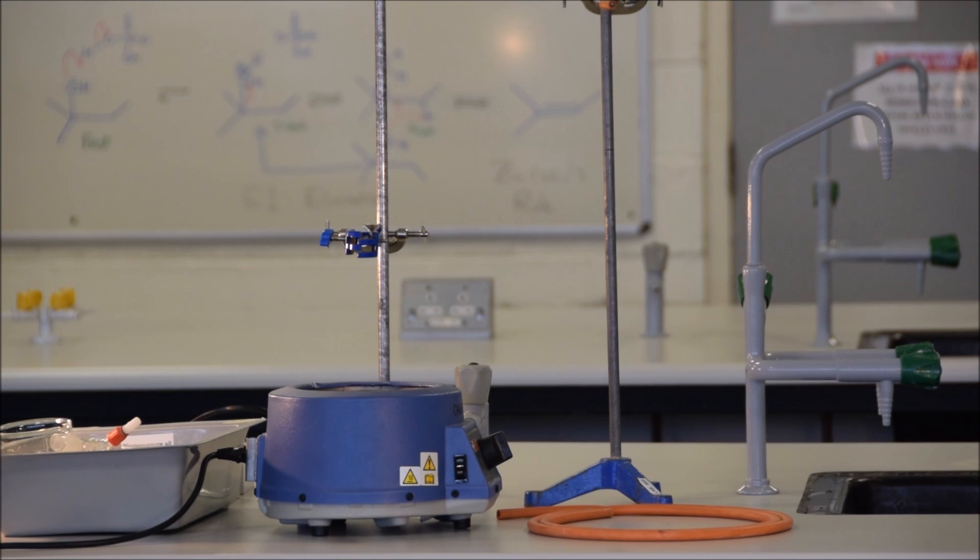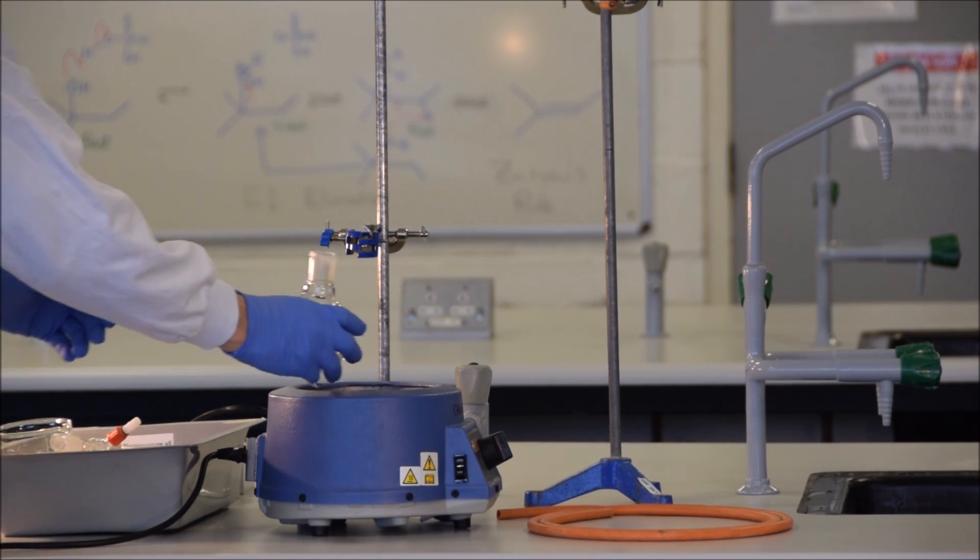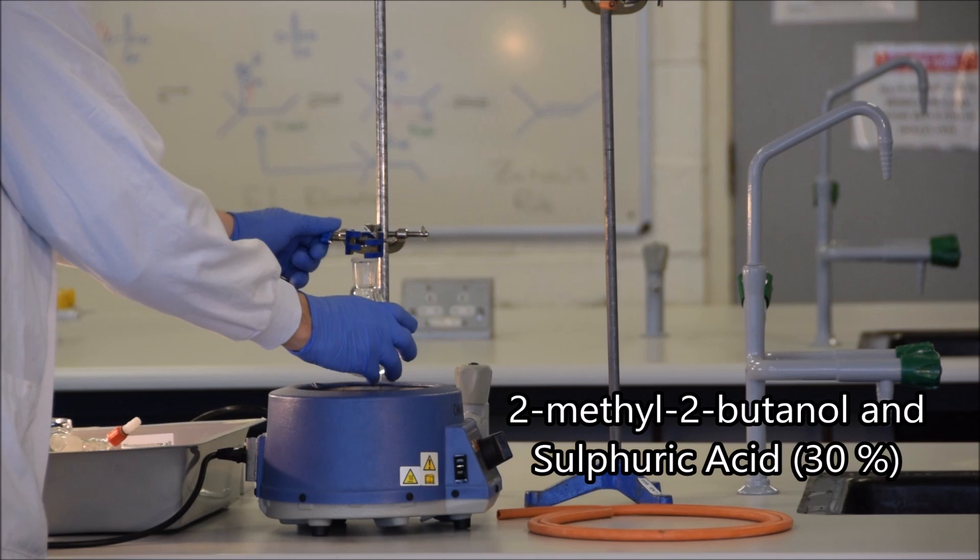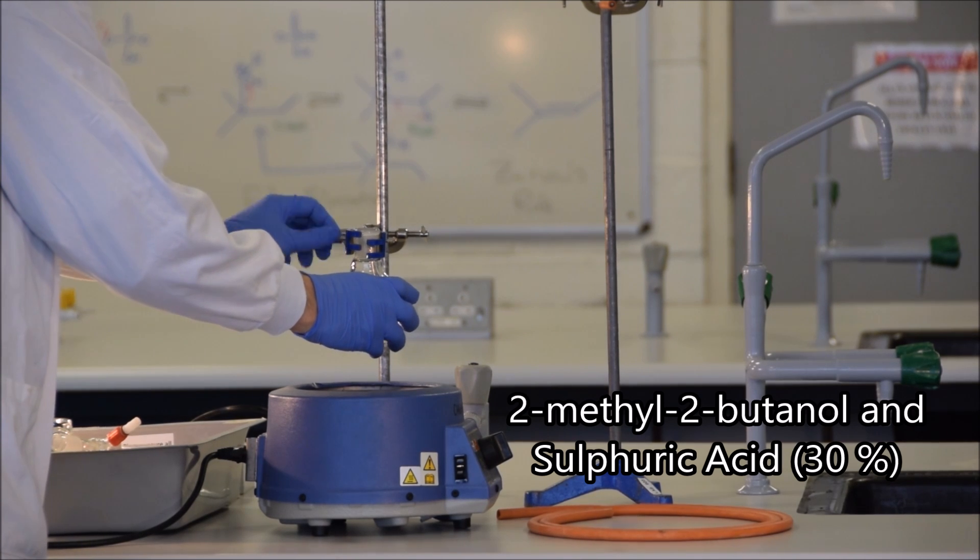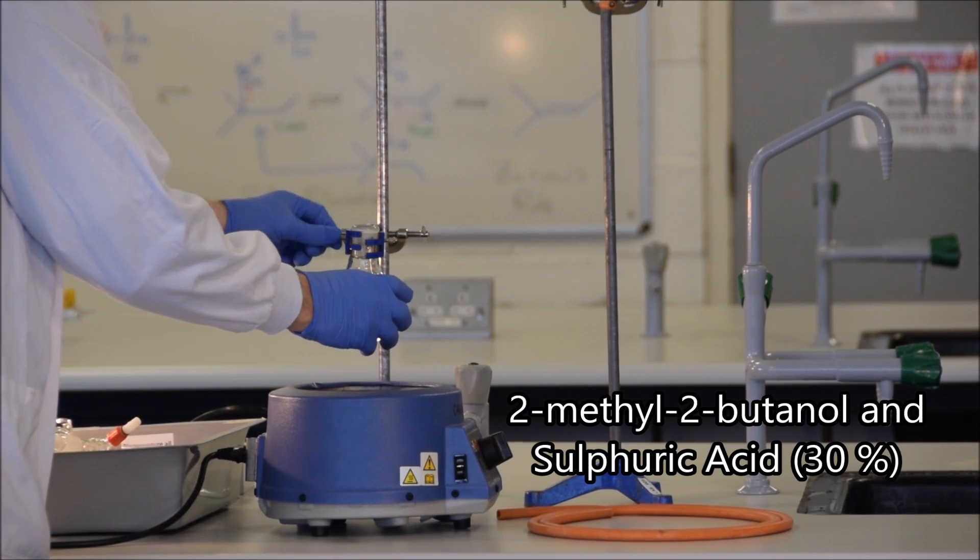You may already be familiar with setting up a distillation apparatus. However, it is imperative that it is done correctly, since the product is highly flammable and very volatile. So if it is not done correctly, the apparatus may catch fire.